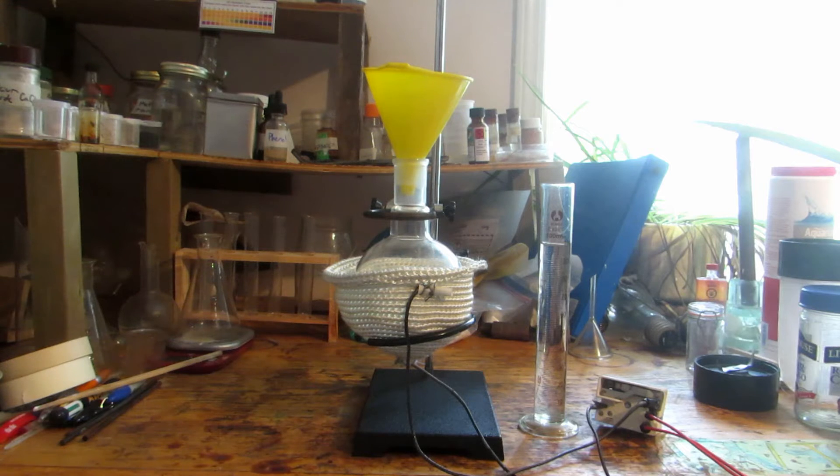Hey guys and welcome back to another video. So today we're actually going to be preparing a compound known as potassium iodide.